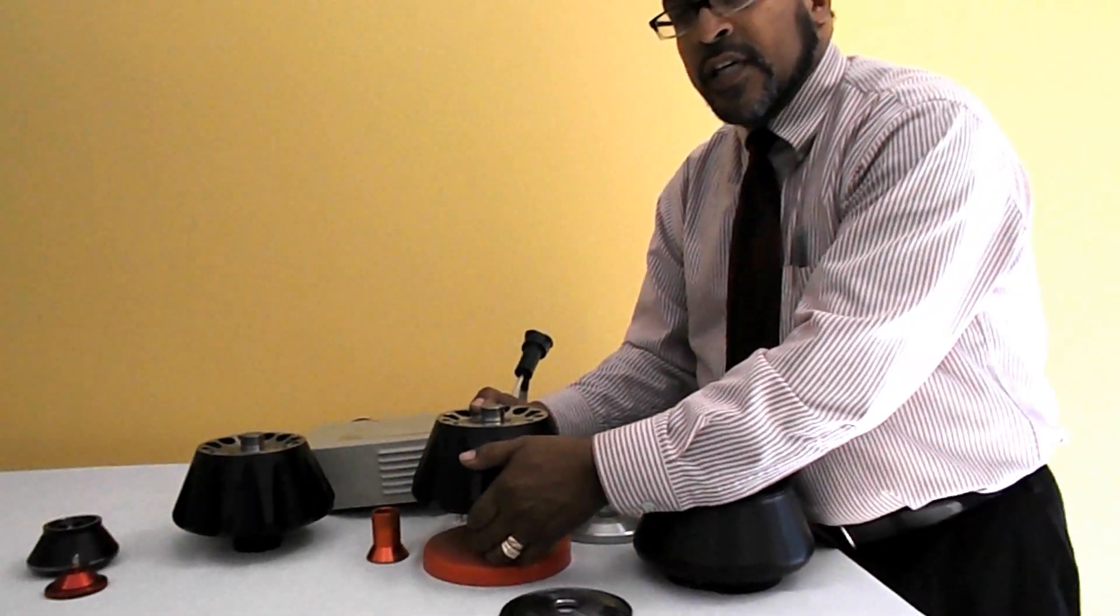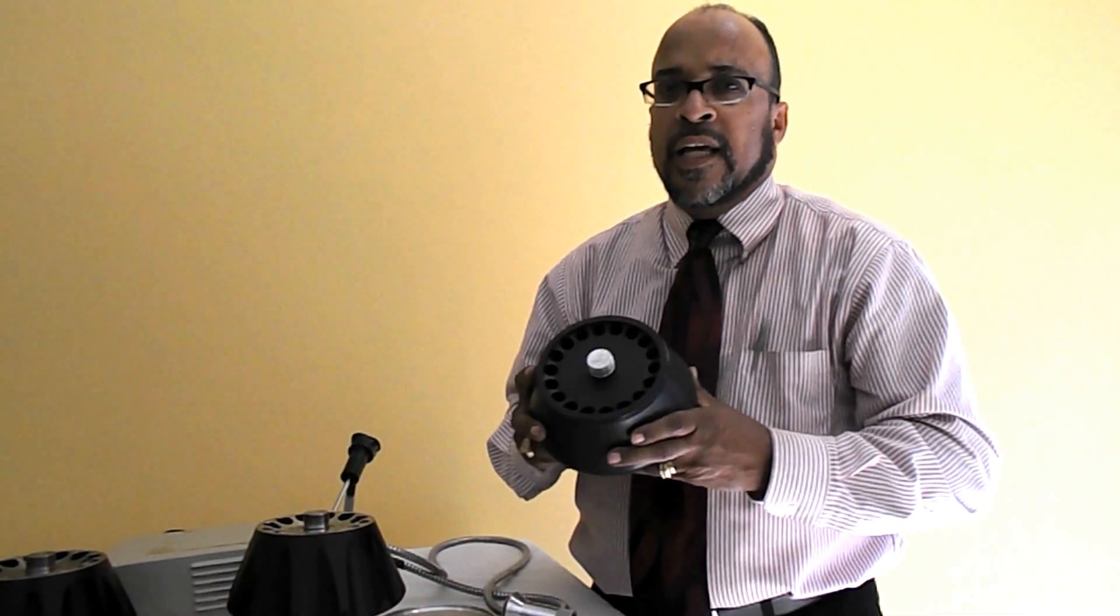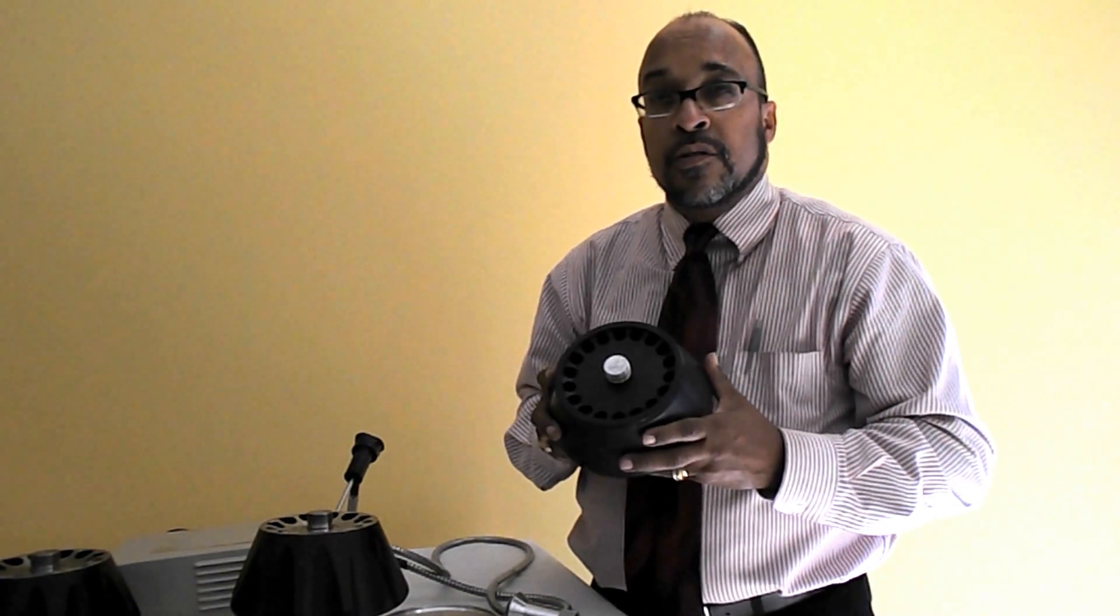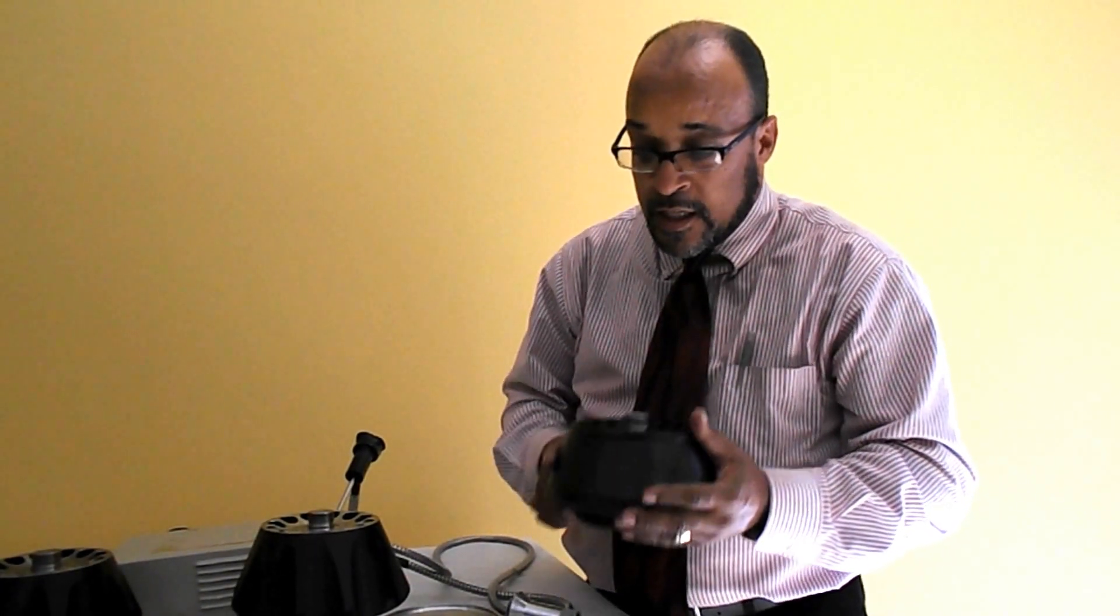This aluminum based rotor takes a lot more care and needs a lot more care for cleaning. Aluminum cannot stand up to scratches and abrasions. It can get scratched so when cleaning use a tipless brush. The same thing with the titanium rotor.